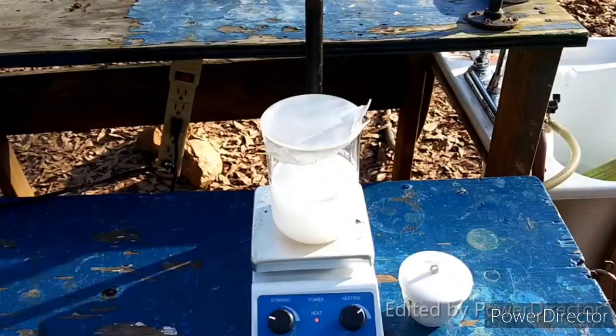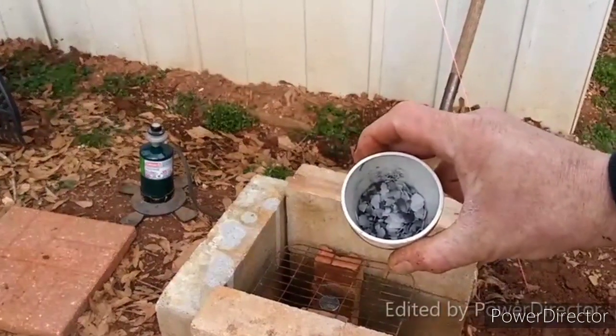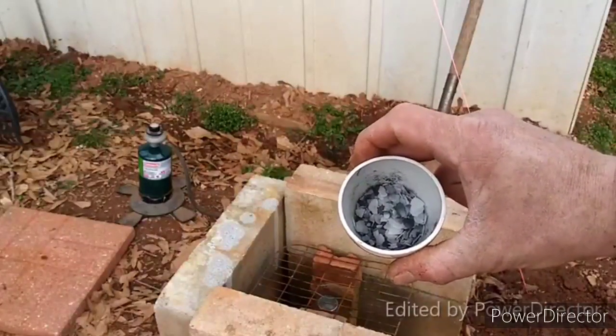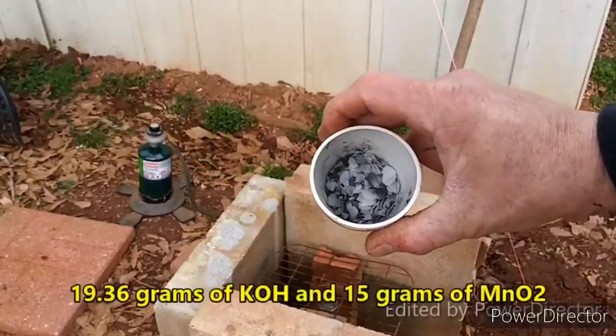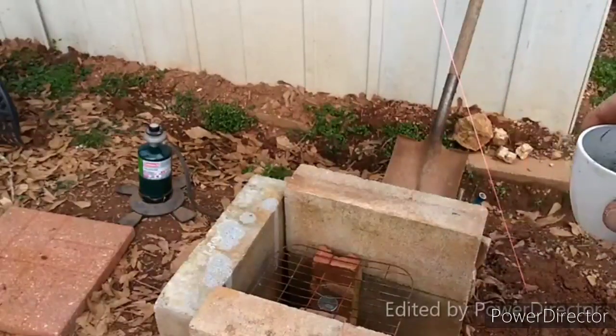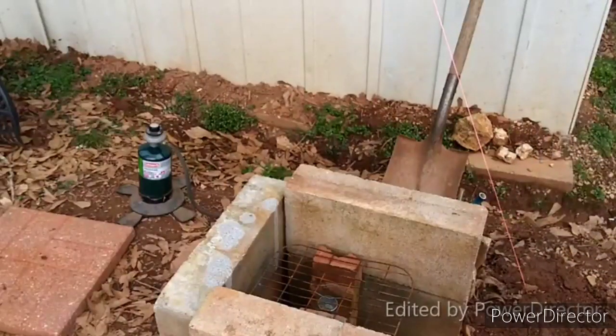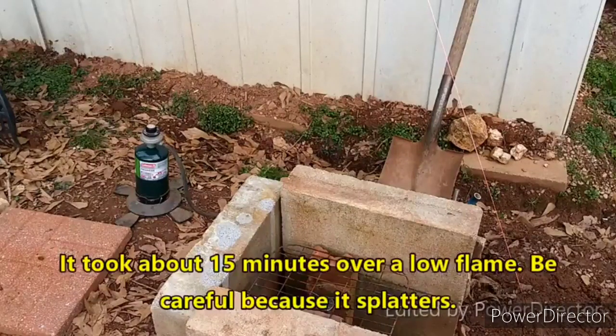On with the show. What we have here is 15 grams of manganese dioxide mixed with two molar equivalents of potassium hydroxide — I mixed this up last night and the weight should be on screen. The paper says to heat this in an oven at 350°C. Sadly, ovens and furnaces we don't have here at the Poor Man's Chemist — it's the poor man's chemist after all. So we're going to figure out how to do this over a burner, keeping the flame low and the temperature moderate.